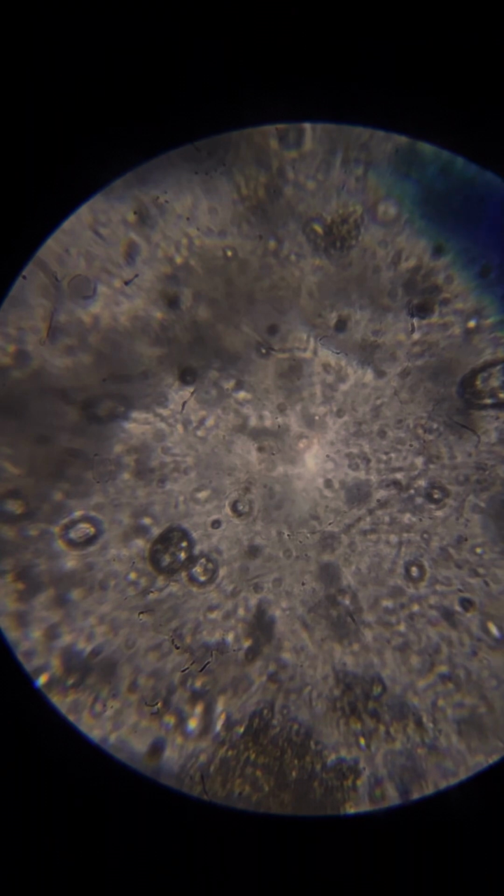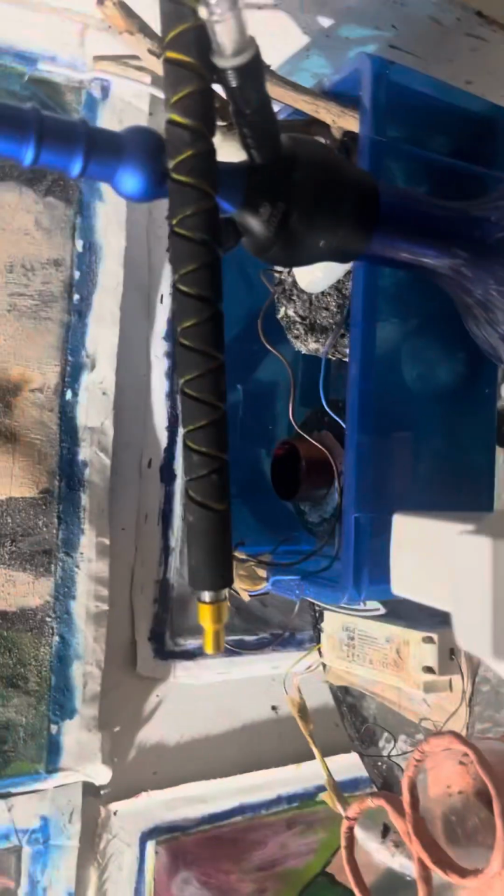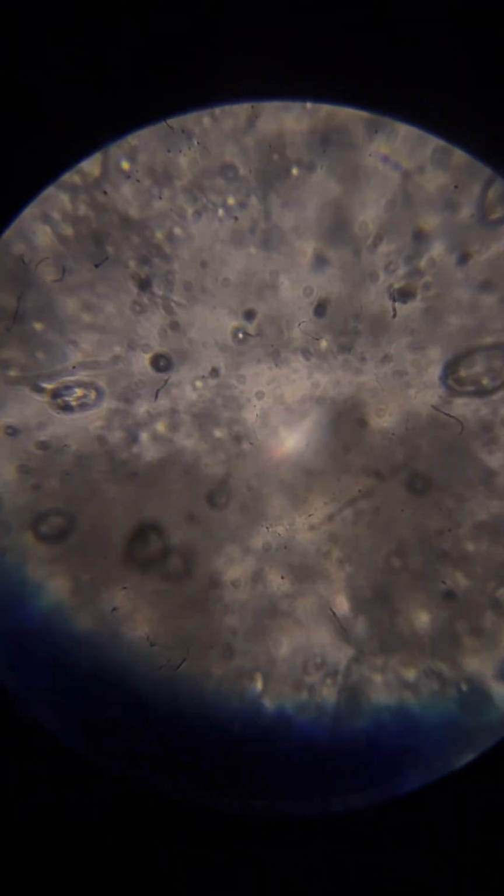I cannot use the tube lens, the pull lens of the eye lens that would allow greater magnification, because it's not proper. I cannot use it with the iPhone. Pulling this out would allow for even higher magnification that now would have been beneficial. But it looks like they are very small life forms, probably synthetics. Almost certainly synthetics, not biological, carbon-based.